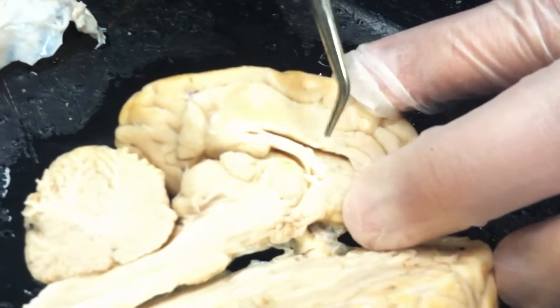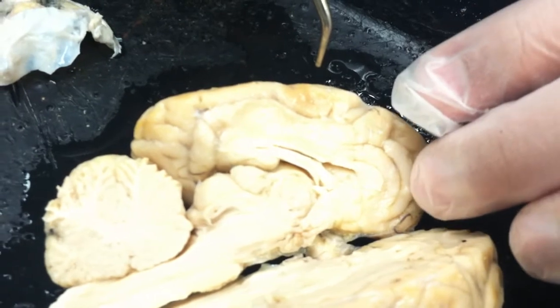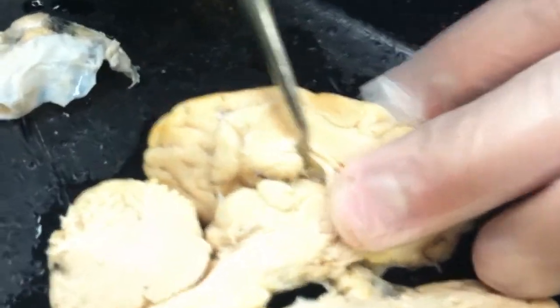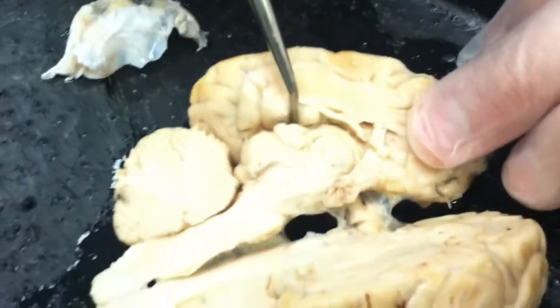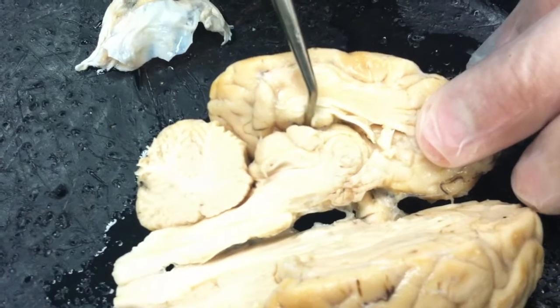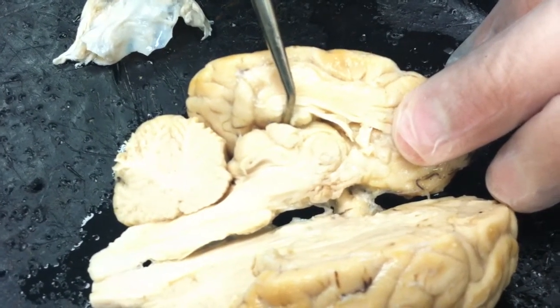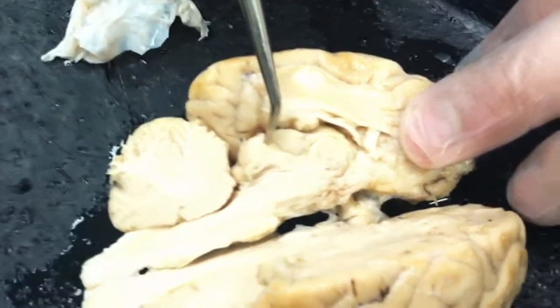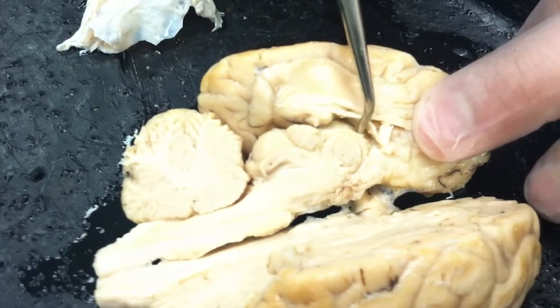The third ventricle then would be a region below this. If I pull this apart a little bit in here, we can see some of this brownish material is actually within that other ventricle. So there's another cavity or another space right there where the probe is running. We've actually sectioned through the third ventricle, right through the center of it. So we have half of it in this hemisphere and the other half over there. It actually comes down and surrounds this entire region. This large structure here passes right through the center of that third ventricle.